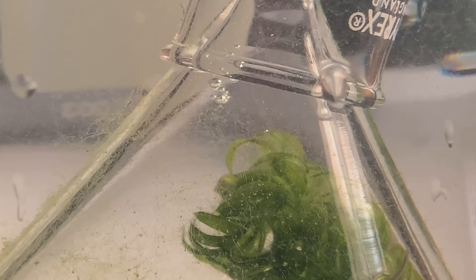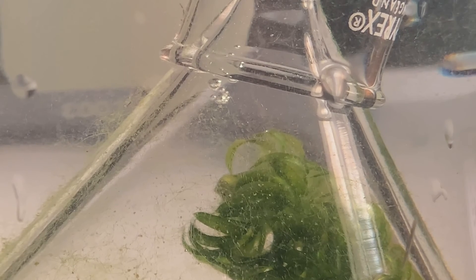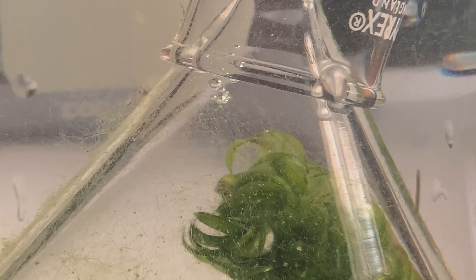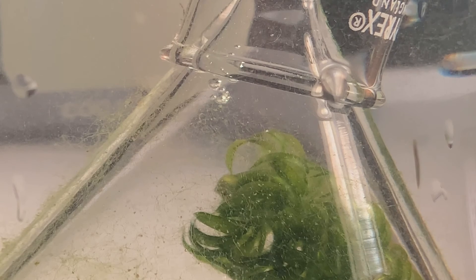This plant is 15 centimetres away from the lamp. Count the number of bubbles produced in 30 seconds, double it, and record it in your results table.